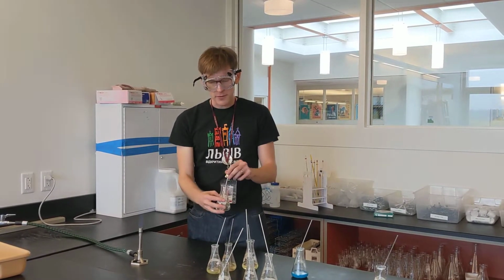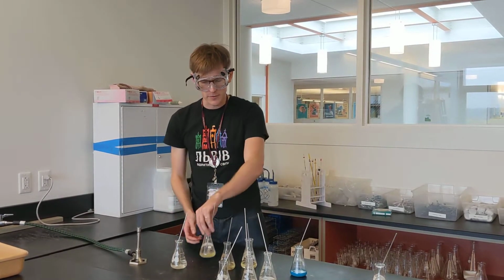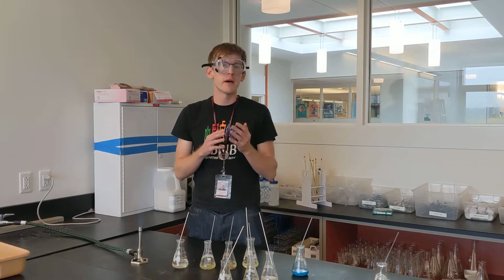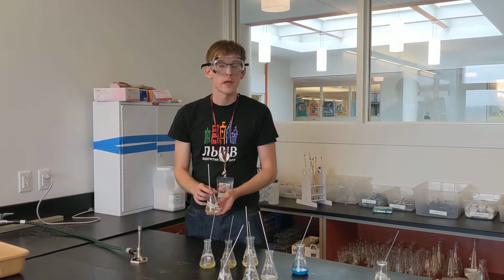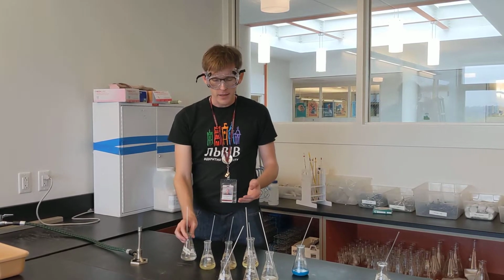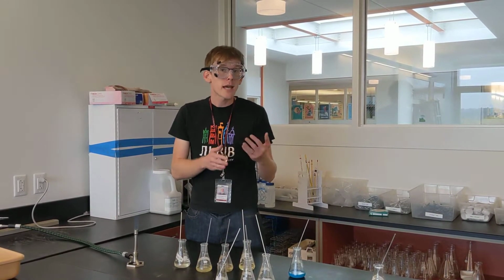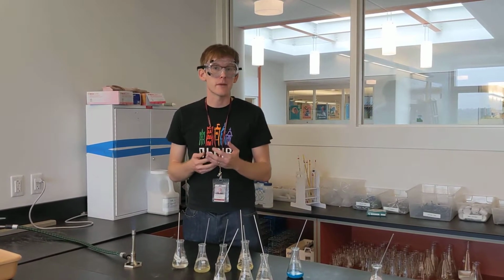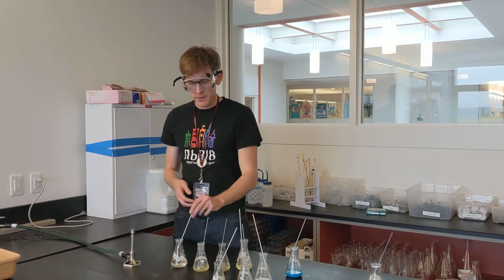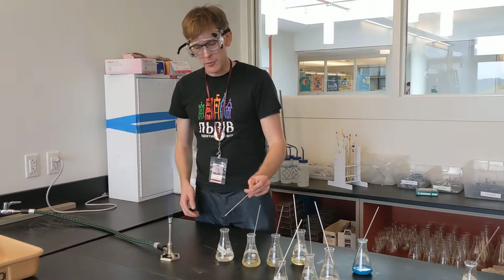So I've got several solutions here. For example, potassium, there's sodium, there's lithium. There are several different metals, they're ions that are dissolved in water. And if I have an unknown sample, for example, of some compound, I can tell what the metal is based on the color of light that's emitted when I put the sample through some heat, through a flame.